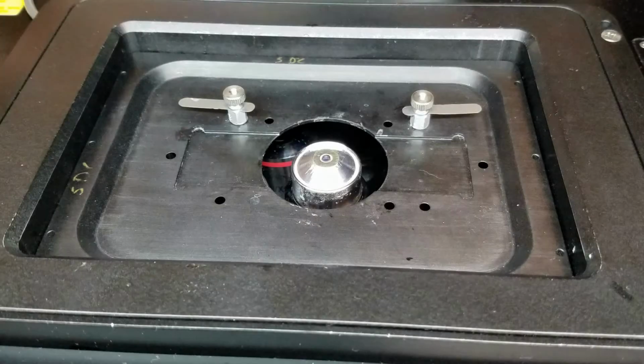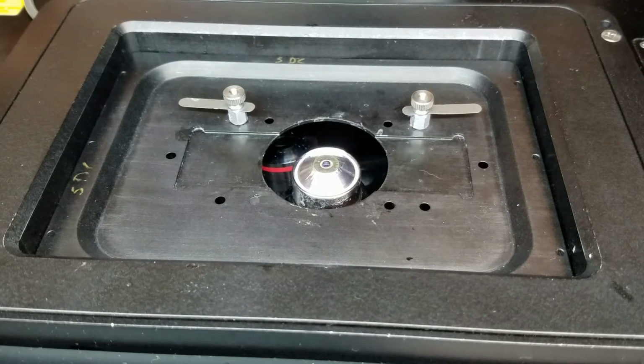Hello. Today I'm going to show you how to add oil to an oil immersion objective. The first thing that you should do is make sure you have selected an oil immersion objective in the software, and you can visually inspect the objective to make sure it says oil on it. The next thing I'm going to do is to lower the objective down to a nice safe height. So in this case, on this Nikon microscope, I look for a value lower than 1000.